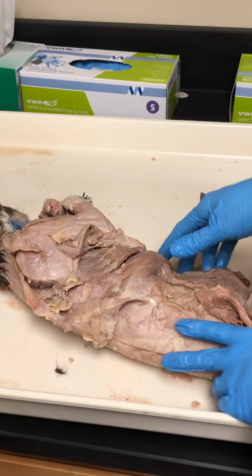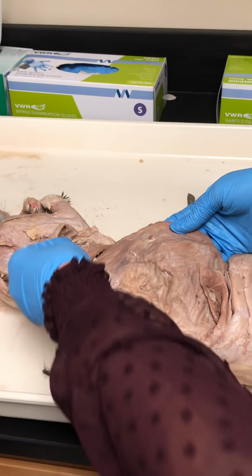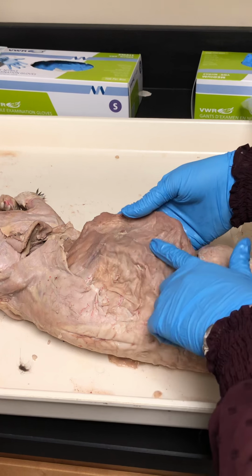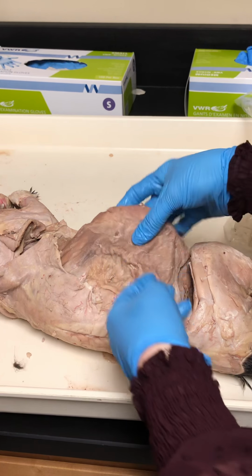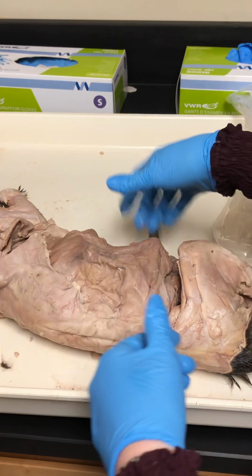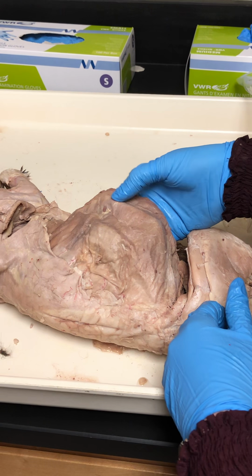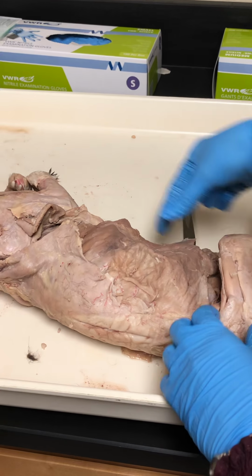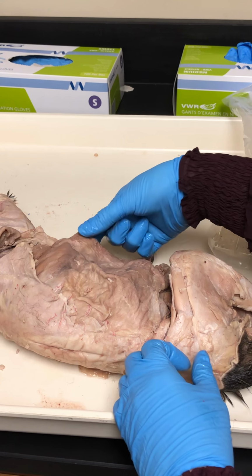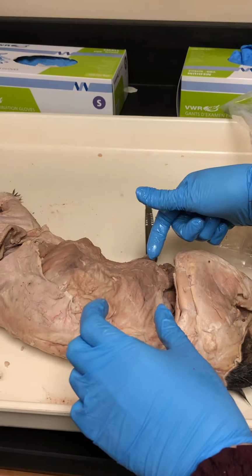External abdominal oblique. That is the external abdominal muscle. It comes right up underneath the latissimus dorsi. So your external, internal, and transverse are all in this piece. They're very thin on the cat, and they all run in different directions. So we can just see the external oblique from here. And the rectus abdominis. That is the vertical line of the abdominal muscles that you can't see well with this being cut, but you can see it on the model. That's the one that goes from the xiphoid process straight down to the pubic symphysis.